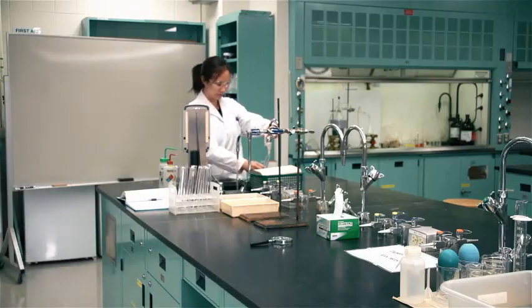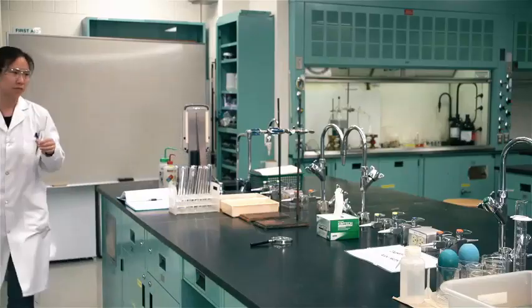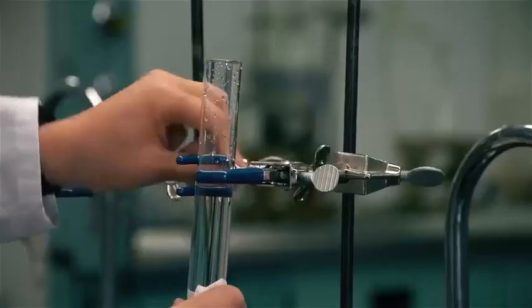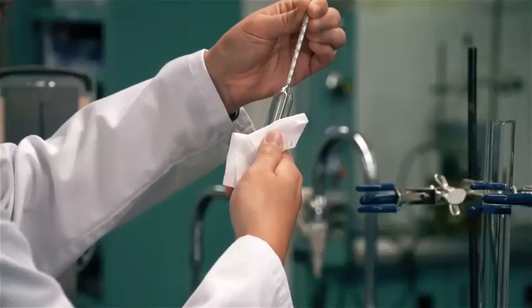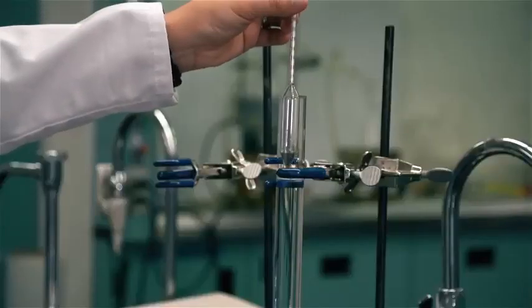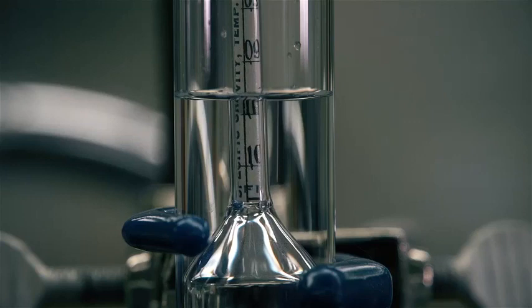To measure the specific gravity using a hydrometer, fill one of the extra large test tubes until it is about 3/4 full. Clamp the test tube with the liquid in a vertical position. Clean the hydrometer with deionized water. Dry thoroughly. Lower the hydrometer gently into the sample, adding a slight spinning motion to assist the hydrometer in floating away from the walls of the test tube and to remove any trapped gas bubbles under it.